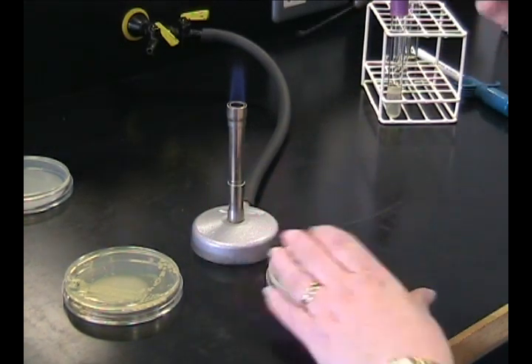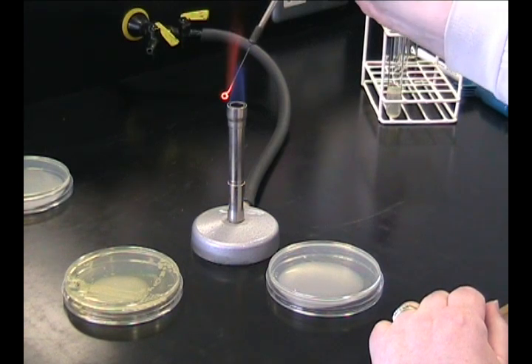Replace the lid and always finish by flaming your loop to avoid any contamination.